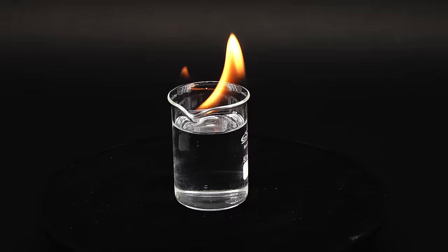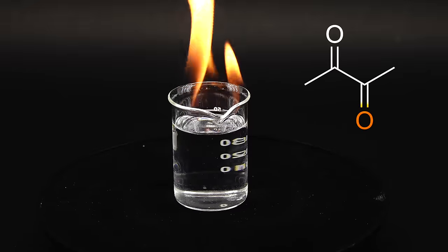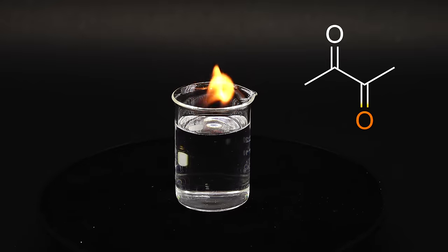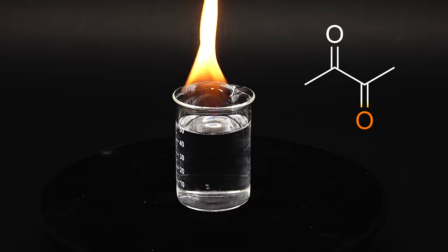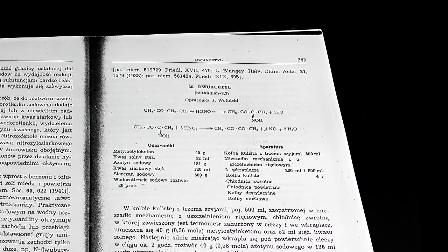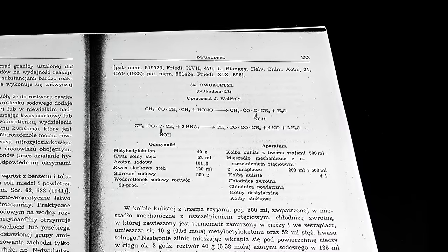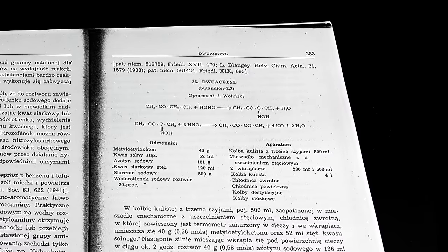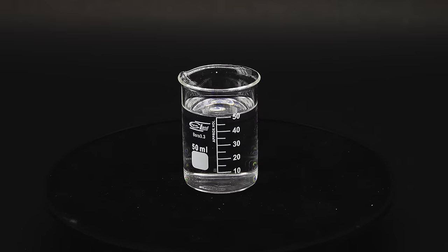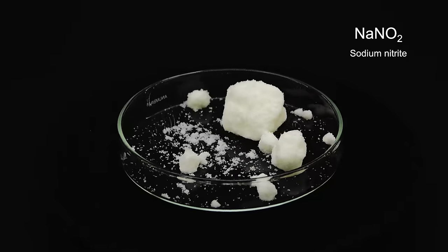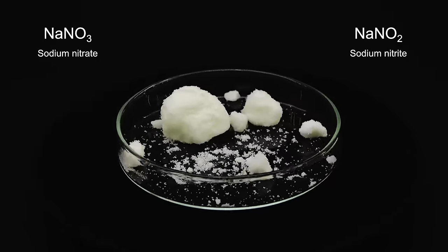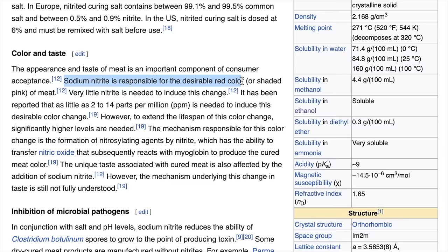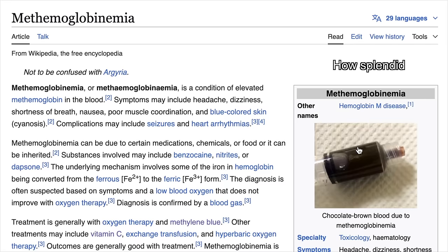To make it into my butter flavoring all I have to do is just add a single oxygen atom onto its carbon chain, which on paper looks simple but as these things often go in reality it is actually quite complicated. Fortunately someone in 1954 already figured it out so I can just rip off their hard work. And to prepare for the first reaction in the synthesis apart from Methyl Ethyl Ketone I have to use something called sodium nitrite. It's a lesser known cousin of the more popular chemical sodium nitrate and is often used as a meat preservative that gives it an unnatural pink color and can make your blood look like some nice hot chocolate.